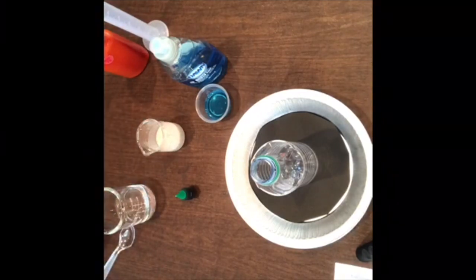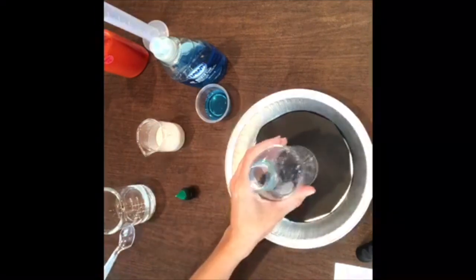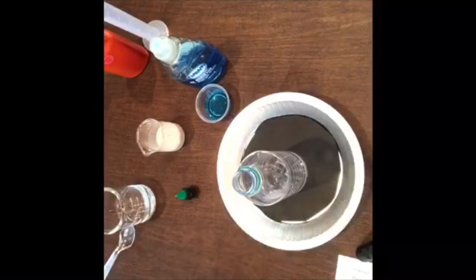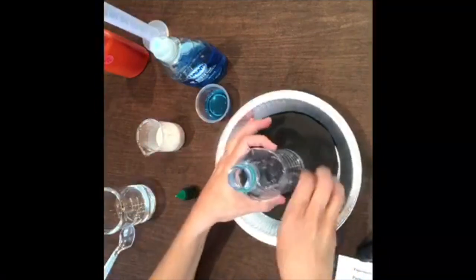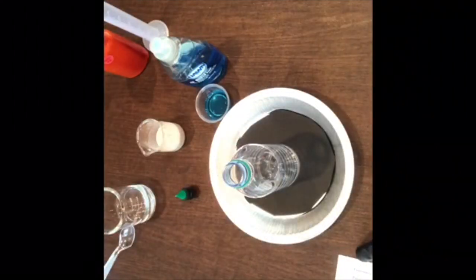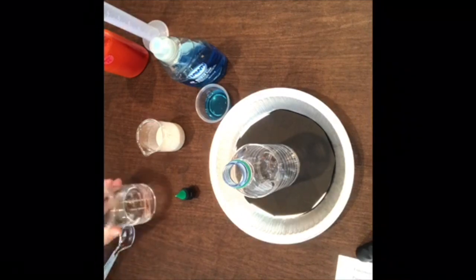Okay, so then it says to place the bottle in the middle of a pie pan or in the middle of a bowl, because it might make a mess and we don't want a mess. I put paper on the bottom just because otherwise it's a little bit shiny and I didn't know if that would bother you. So then it says measure 80 milliliters of hydrogen peroxide and pour it into the medium beaker.